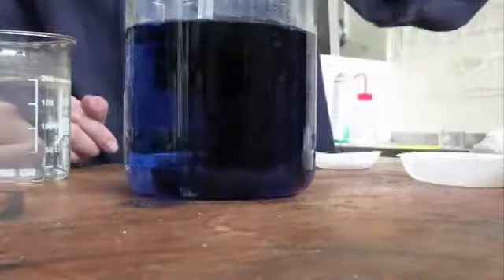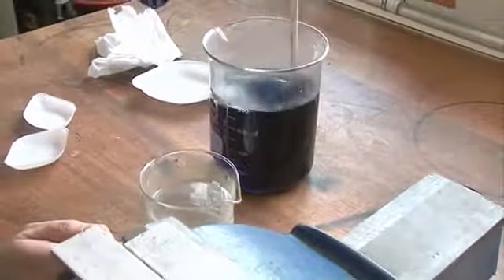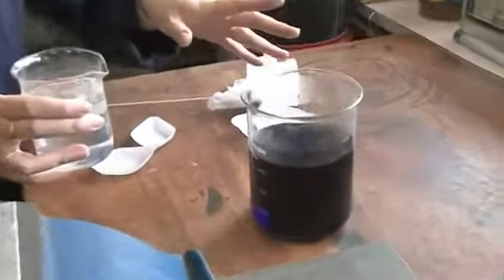Okay, we're going to make sure it's fully dissolved in the glucose solution. So really want to make sure that indigo carmine, the glucose and the water are all mixed together. So we've got our blue solution here, we've got our colourless solution in here. We'll combine the two and you can watch what happens.